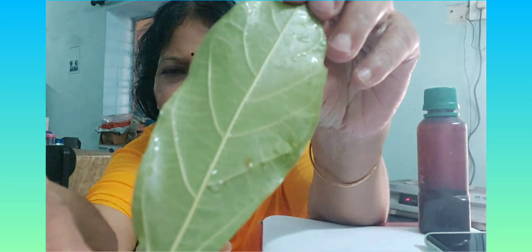All that you need are a few leaves which you can keep soaked in water. Here is a leaf. This is a leaf that you can see well. This leaf is showing the midrib and the veins which are also quite prominent. If I show you the back side of the leaf, you find some difference in the color.